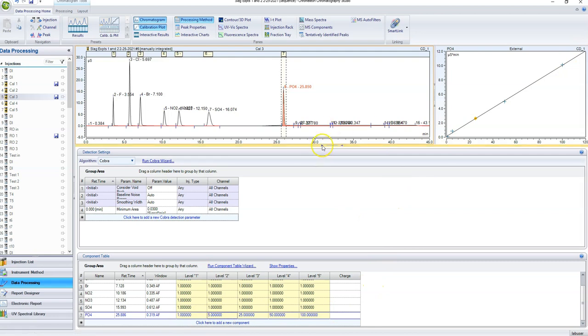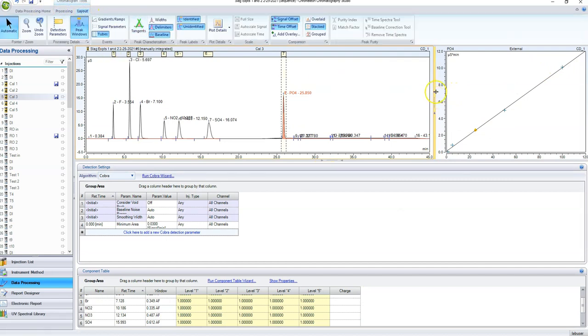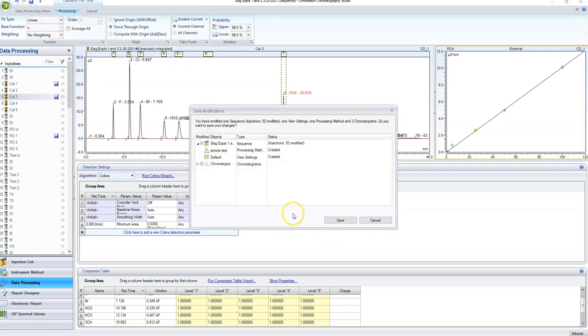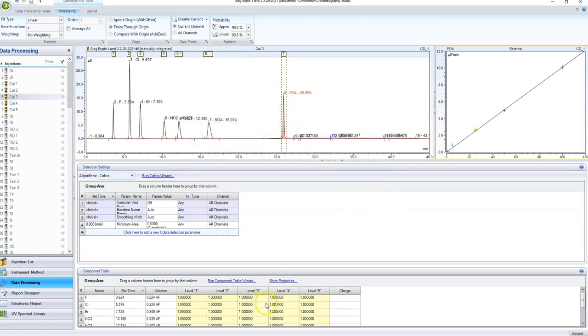Okay. So yeah, if it's straight, you know that your samples are going to be measured accurately. If you go to processing here, something that I like to do generally is force it through the origin, or at least compute it with the origin, because 0, 0 should be a point on your calibration curve. Now when I hit save, it's going to save all the changes that I made to my processing method and everything.